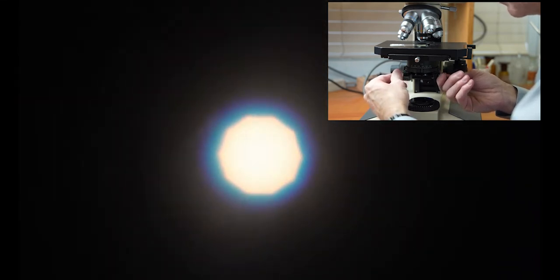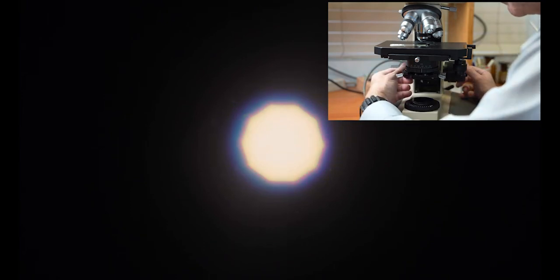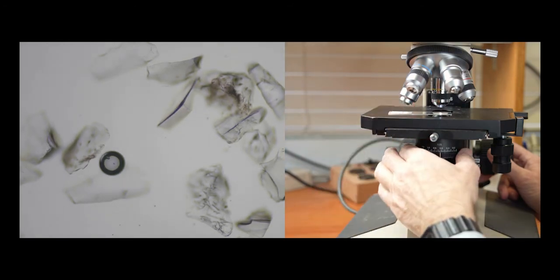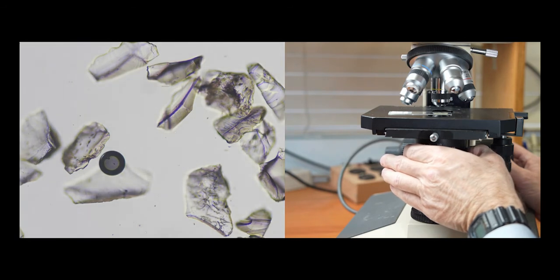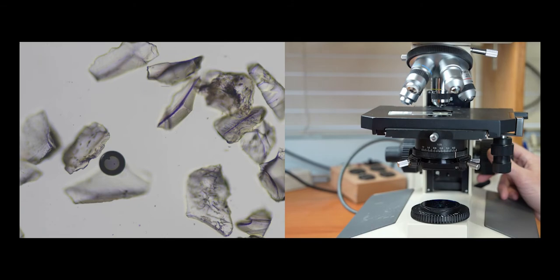Once in the center of the field of view, you may need to refocus the condenser on the field diaphragm. This may take several tries to get it perfect focus. Condenser is too high, you'll see orange. If it's too low, you'll see blue. Next, you'll want to open the field diaphragm to just outside the field of view. Bring the specimen back into the center of the field of view and begin to adjust the substage condenser diaphragm to get the best contrast and resolution for your sample.